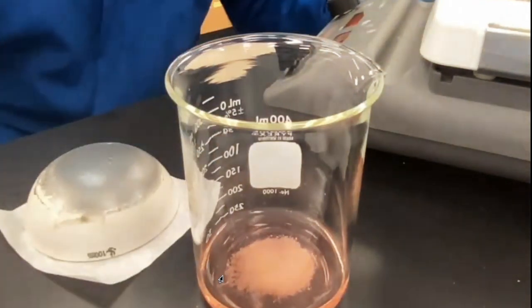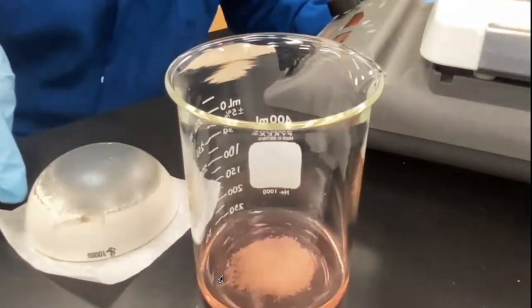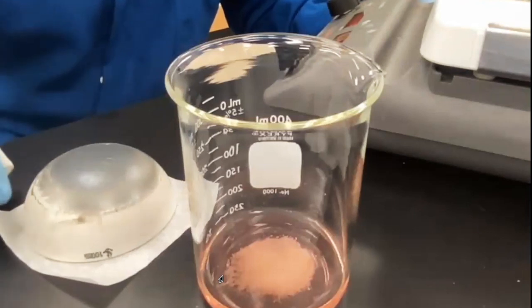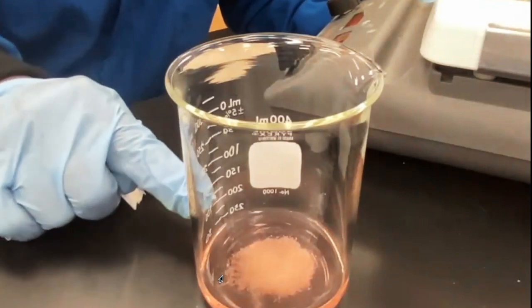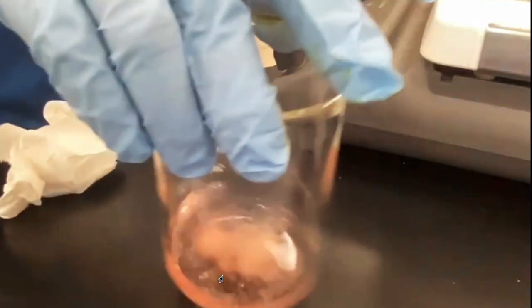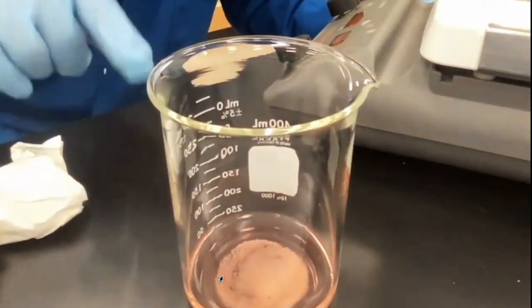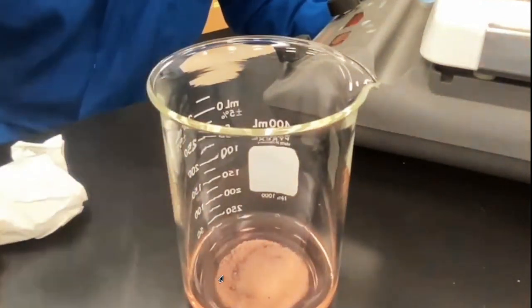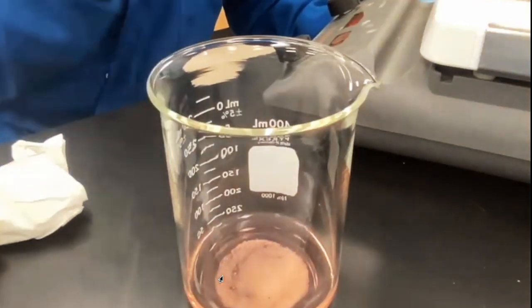What property was exploited in A to separate it from B and C? That's one thing. Okay. And what was the technique that you use? Then we have B and C here. Put it in water. It's not separated yet because they're still there, but now it's in water, and then we're going to do a decanting, and now that separates chemical B from C.